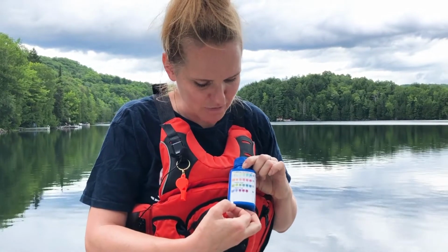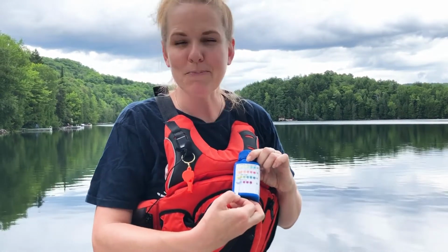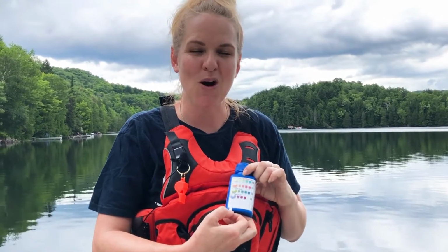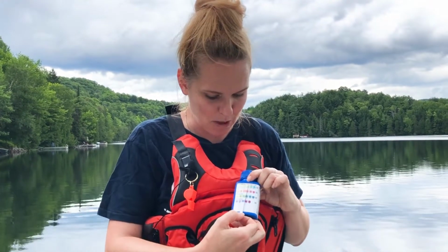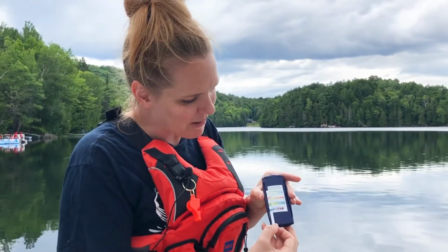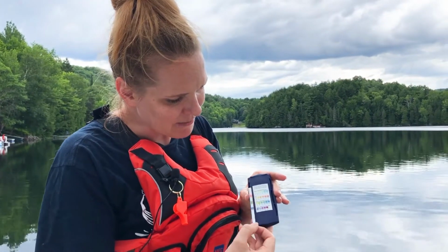You shouldn't expect the alkalinity and hardness to change very much. And chlorine is pretty abnormal in fresh water. However, we've seen in some urban centers where people are getting readings up at 4, showing that there is some chlorination happening in those water bodies. You can also compare on the back here. It's the same idea. You can compare the colors.